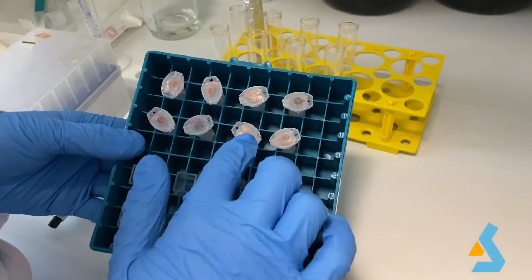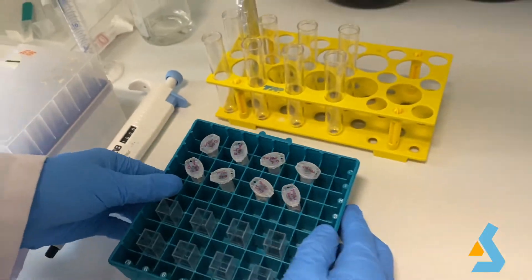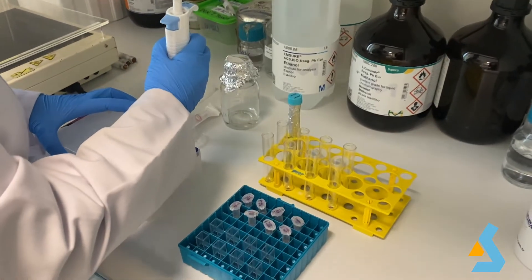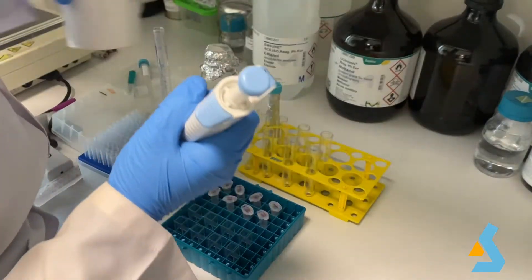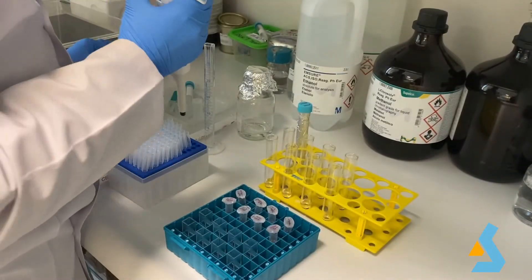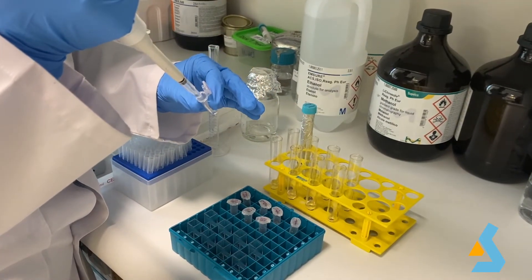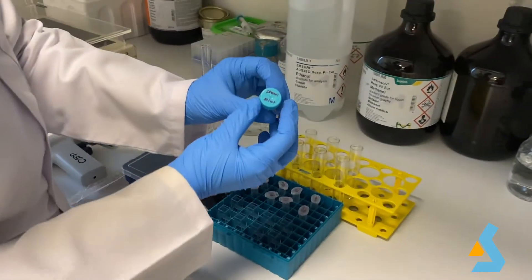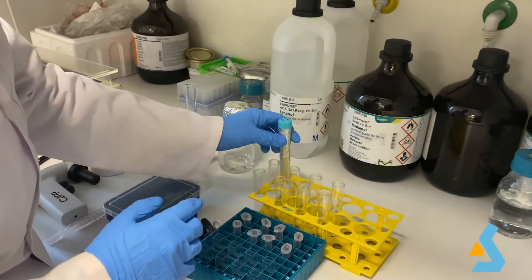First, we prepare glucose solutions with concentrations varying between 0.01 mg per milliliter to 0.2 mg per milliliter. We also have the unknown concentration sample. We take 1 ml of each specimen into glass tubes, then add 50 µl of 80% phenol solution to each tube. Since phenol is an aromatic compound, it should be stored in the dark.